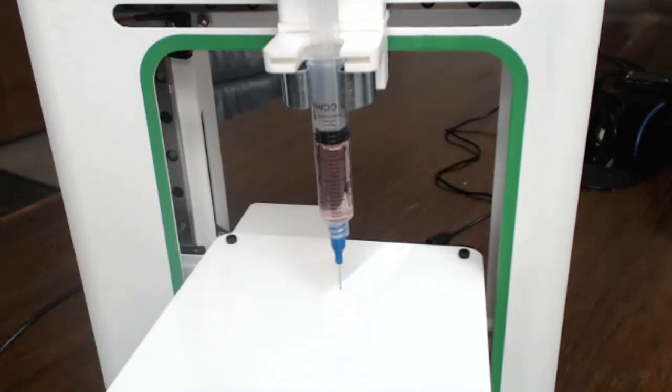And the final one we're going to do is when you print something at really low diameter, or really high resolution, so to speak. When you're printing in the 100 micron ranges, the speed actually becomes a really important parameter. So Oliver will demonstrate a couple of prints that show that with the right speed, you can actually get really good prints.